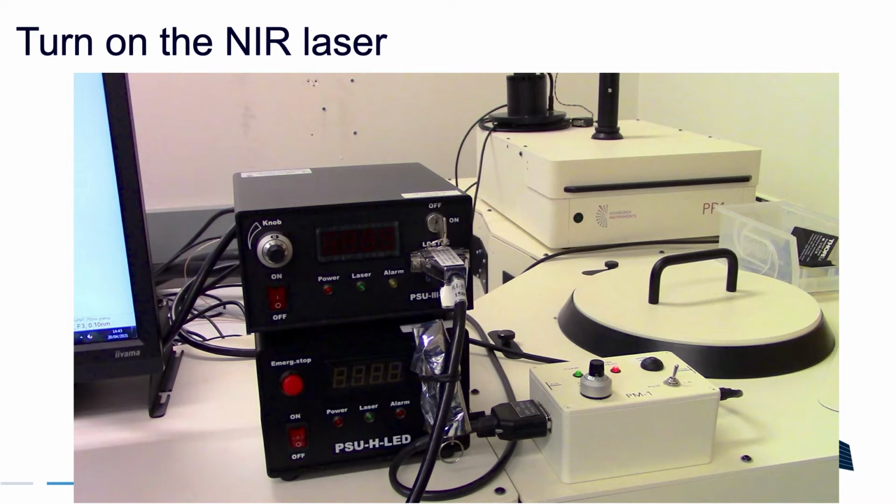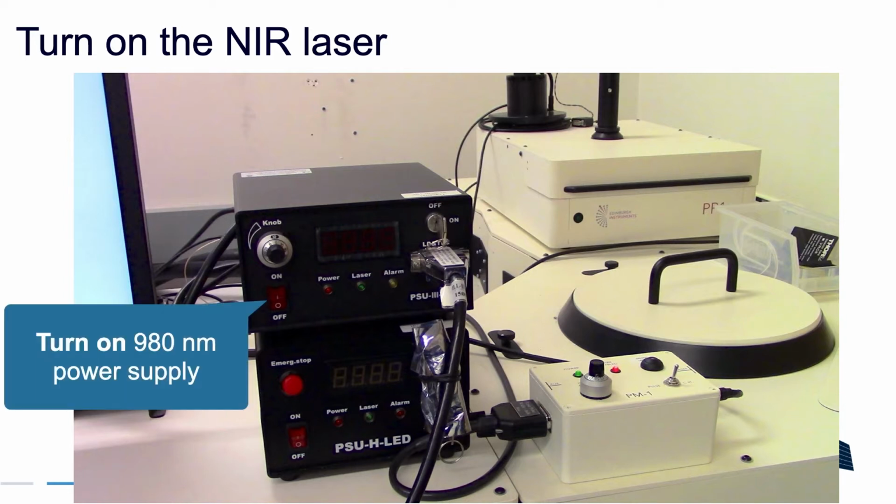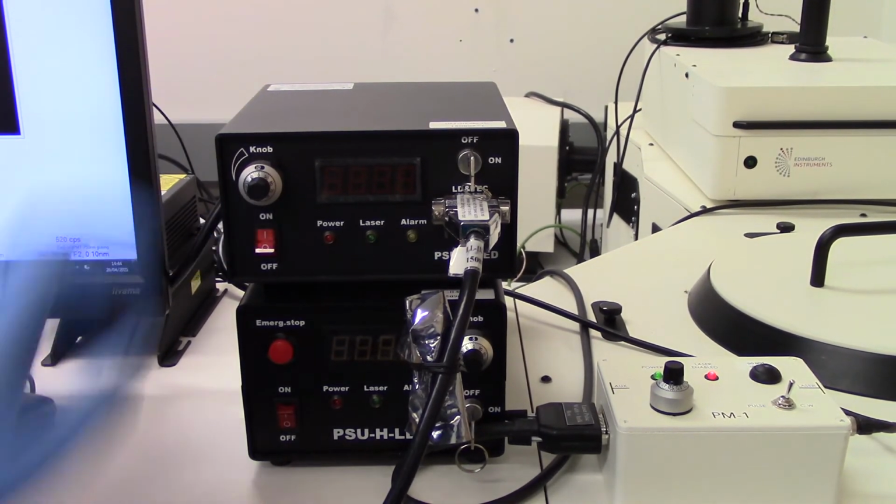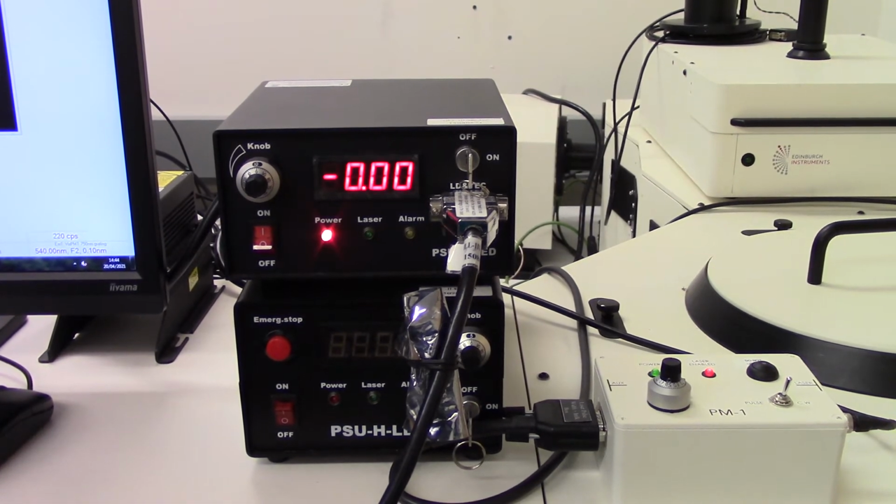Next, we'll turn on the laser. If we're using the 980 nanometer laser, we'll turn on the power supply switch shown here. The 800 nanometer laser, again, is the power supply located below the 980 nanometer laser.